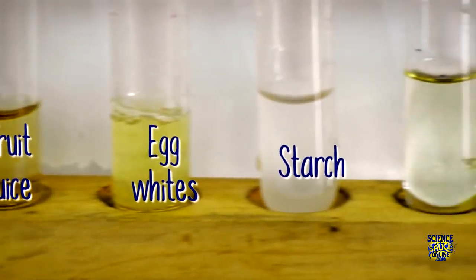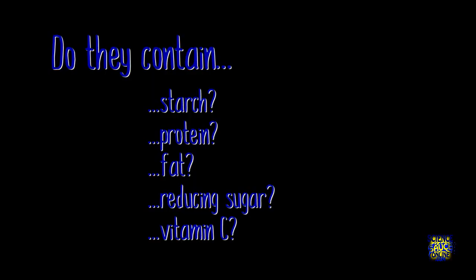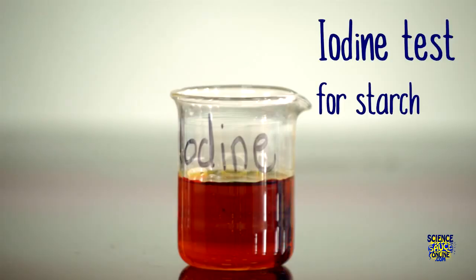We're going to be investigating fruit juice, egg whites, starch, regular cooking oil, and we're also going to use distilled water, etc. Let's start with the iodine test, which is the test for starch.